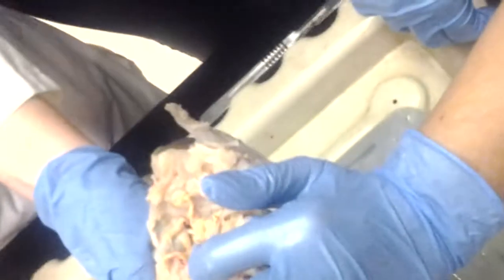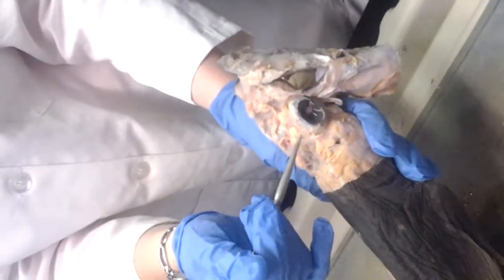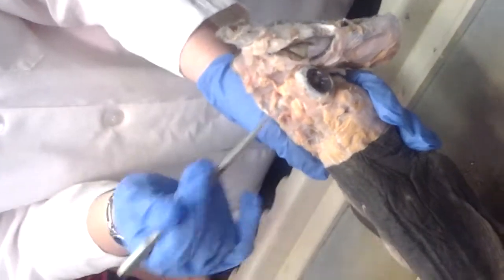What was the name of this that originates, that makes a jaw? Good question. Here we have these two prongs of cartilage that stick up into the cavity of the brain. Does anybody remember what those are called?